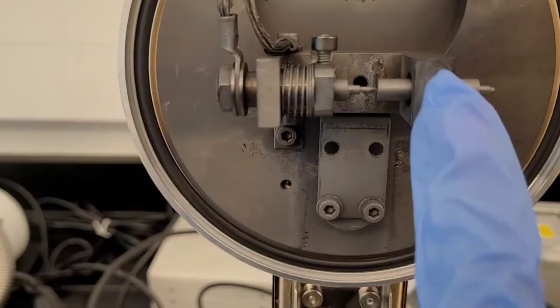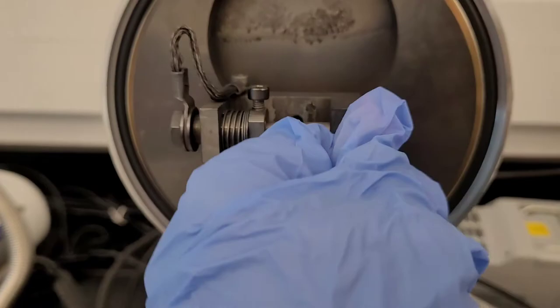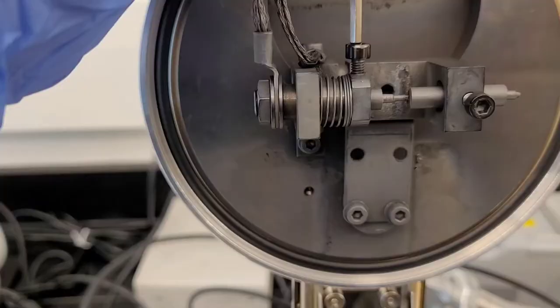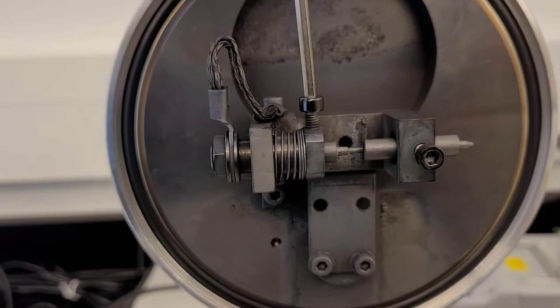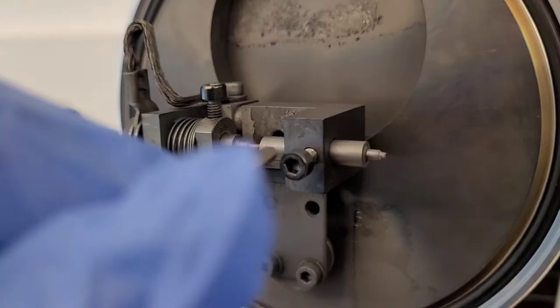This is the instrument that we use to do the coating, and this is the graphite. It's good practice to always take it out and sharpen everything and ensure that there's a good contact again, because every time it's used the whole contact gets a little bit used up.